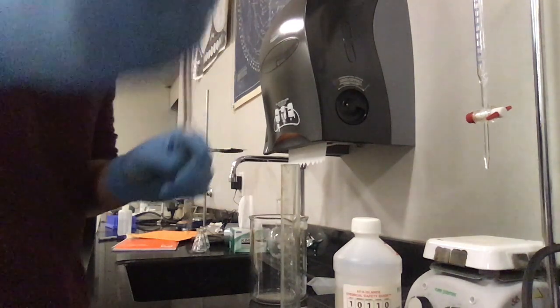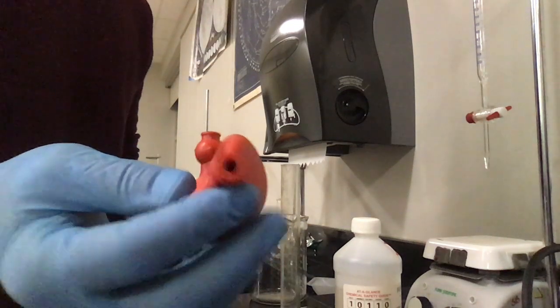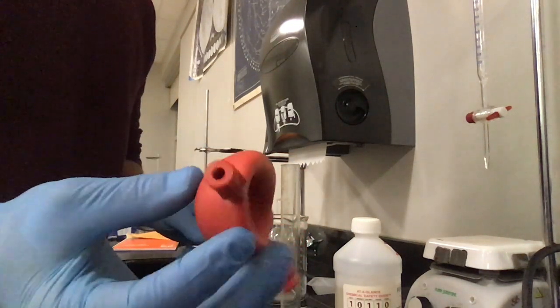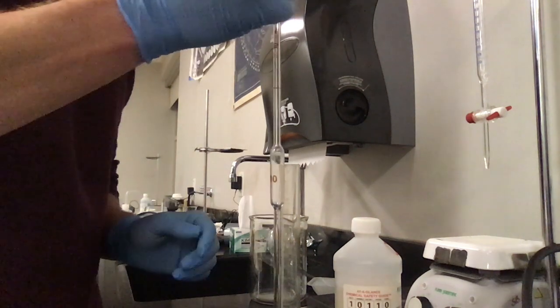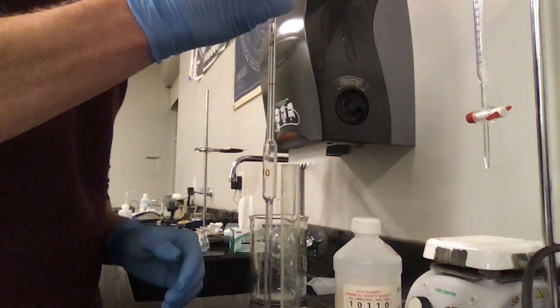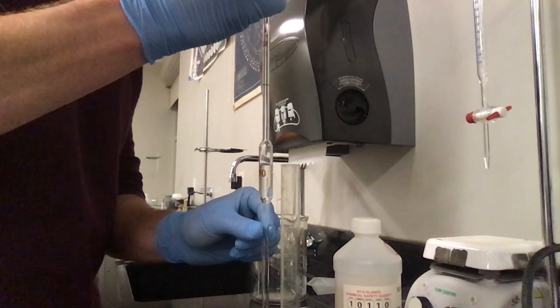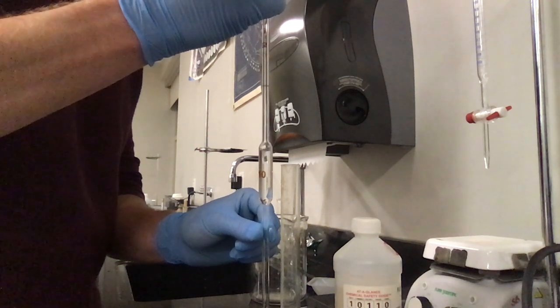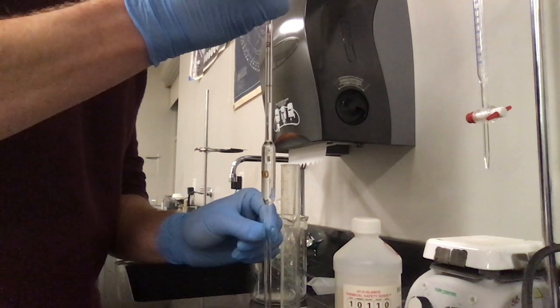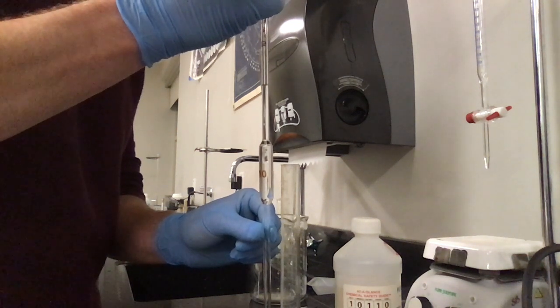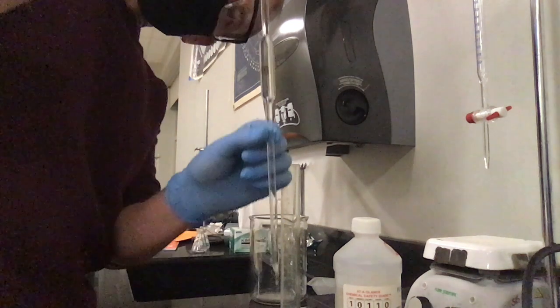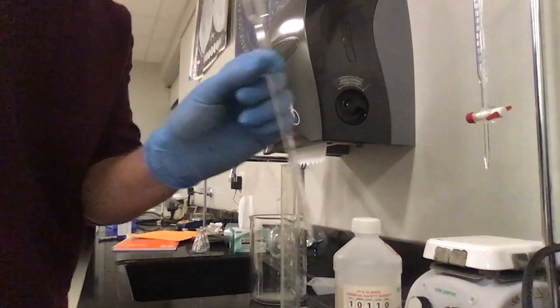So I'm just going to, I push the A button on top to get the air out. I've made my negative pressure here. I'm going to press the S button for suction. Fills that little bulb, and then you slow way down as that bulb fills. Oh, nailed it, man.